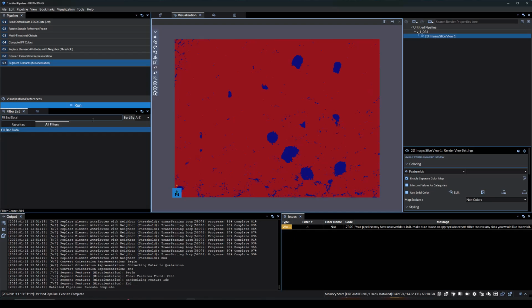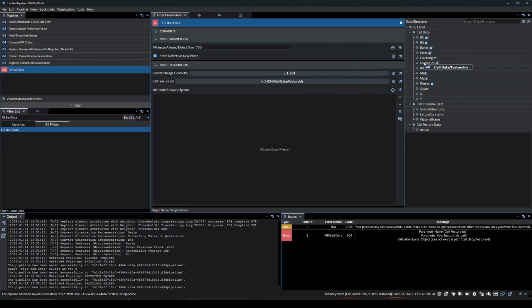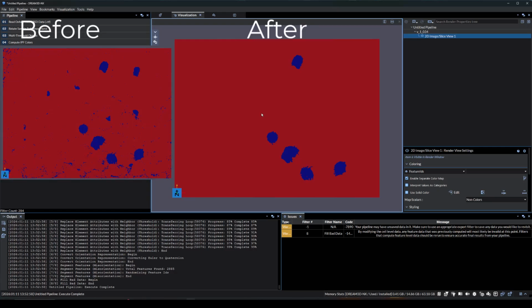Now we'll need a Fill Bad data filter. The minimum allowed defect size for this dataset is 750. We'll populate the paths, then run this pipeline again. Now the smaller areas have been filtered out and we're left with just the large unindexed areas. Here is a before and after of this change.